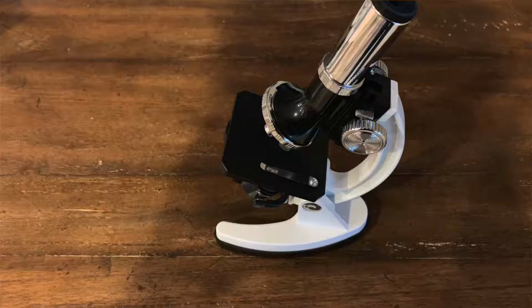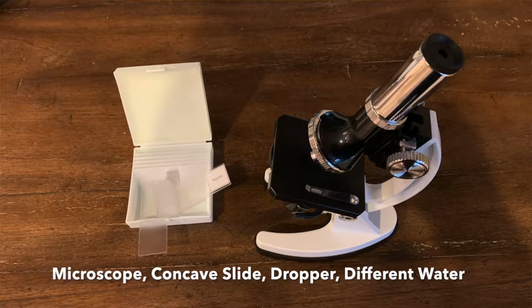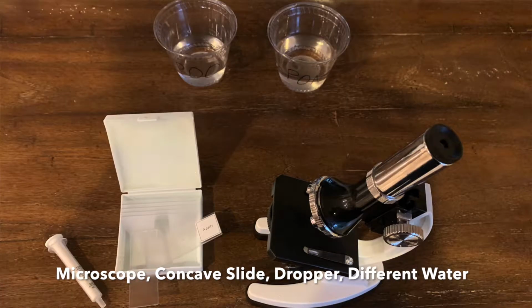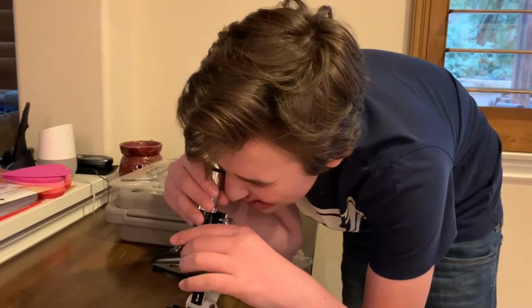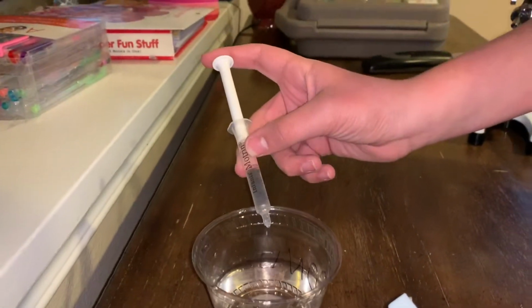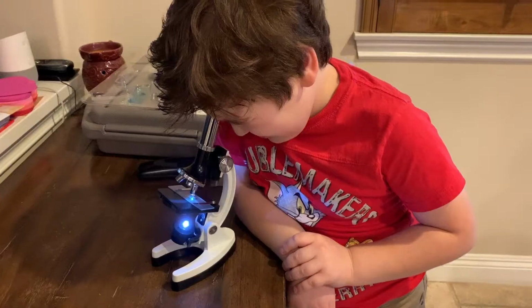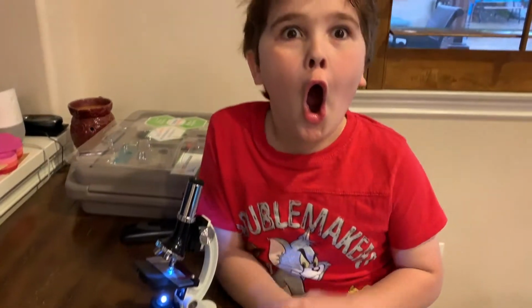You will need a microscope, a concave slide which can be found on most microscopes, a dropper, and different sources of water. First, set up your microscope, preferably to the highest setting. Next, take your dropper and place different samples of water on your concave slide. Then observe your samples and try to see if you can find any organisms inside the water.